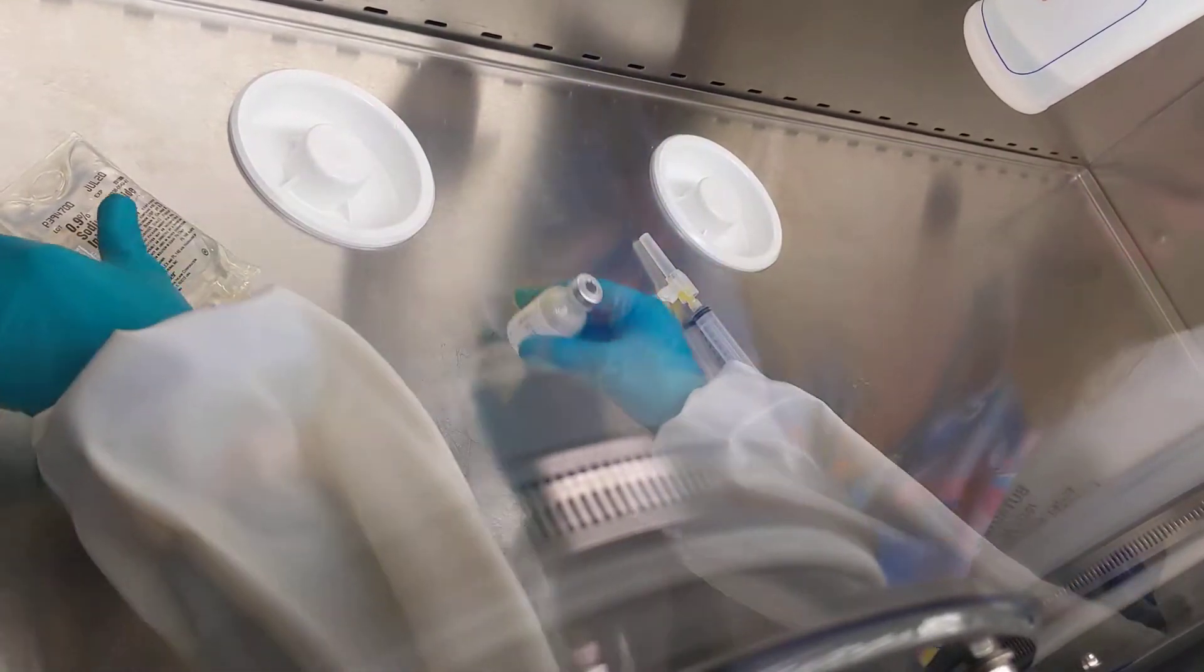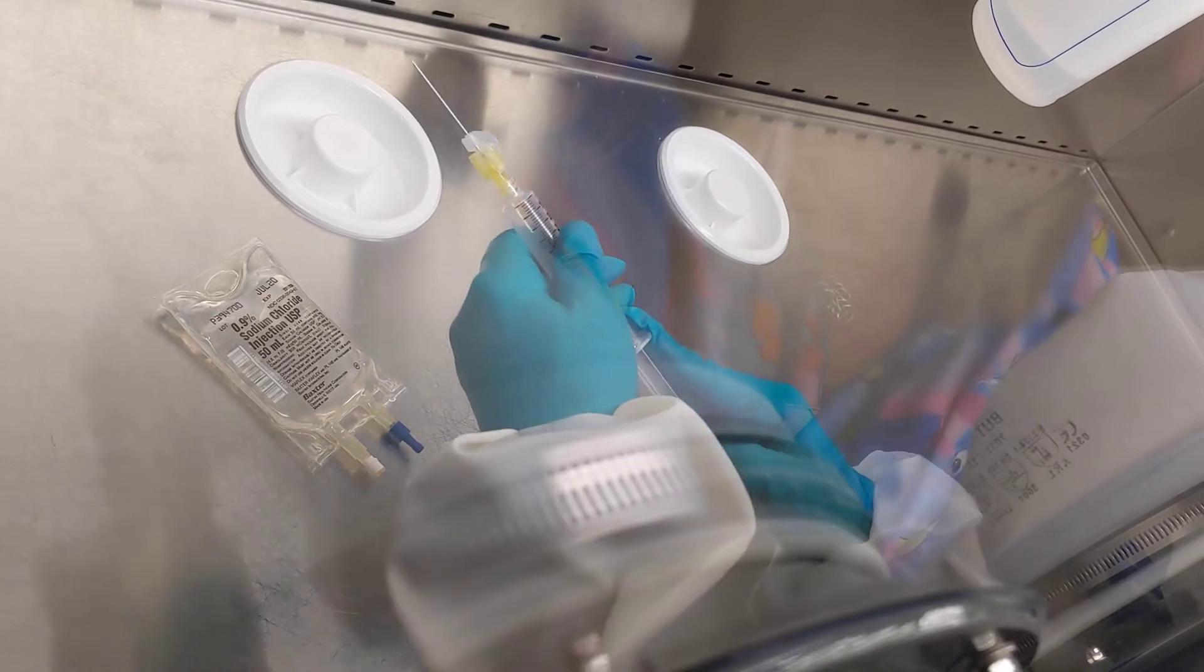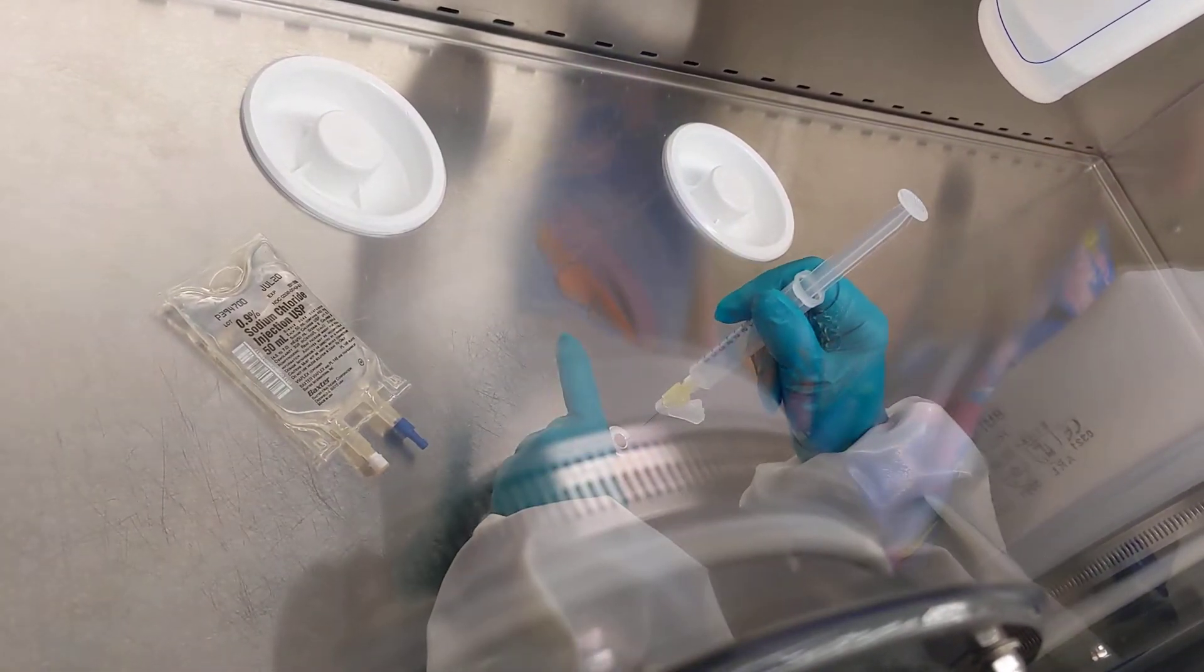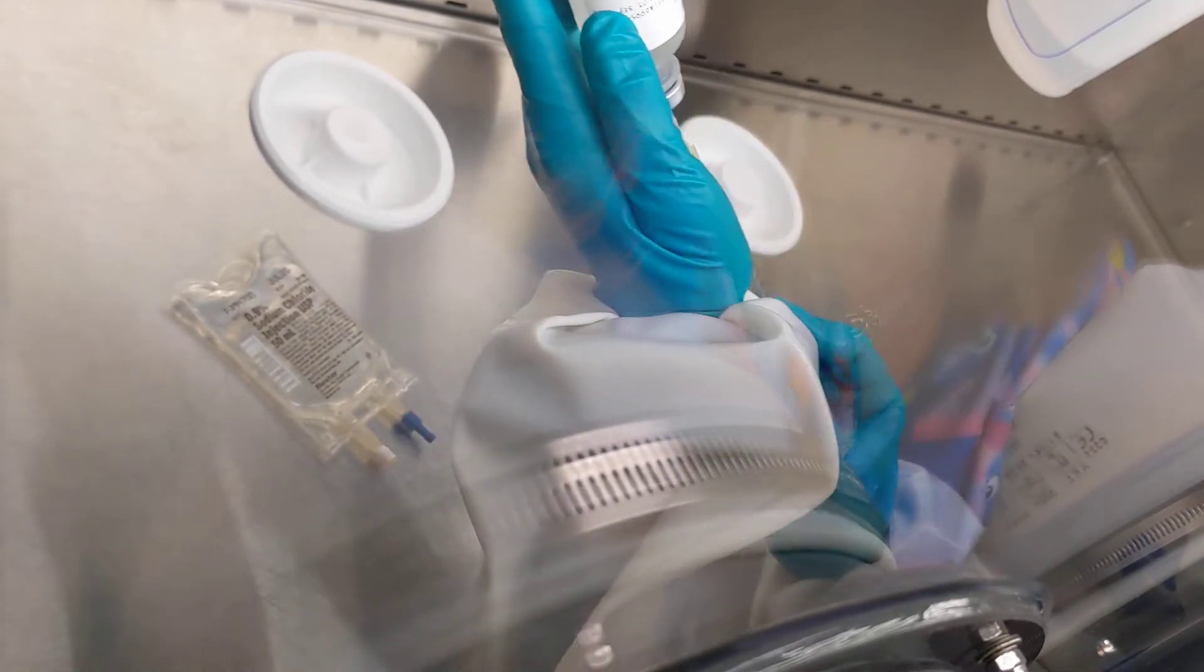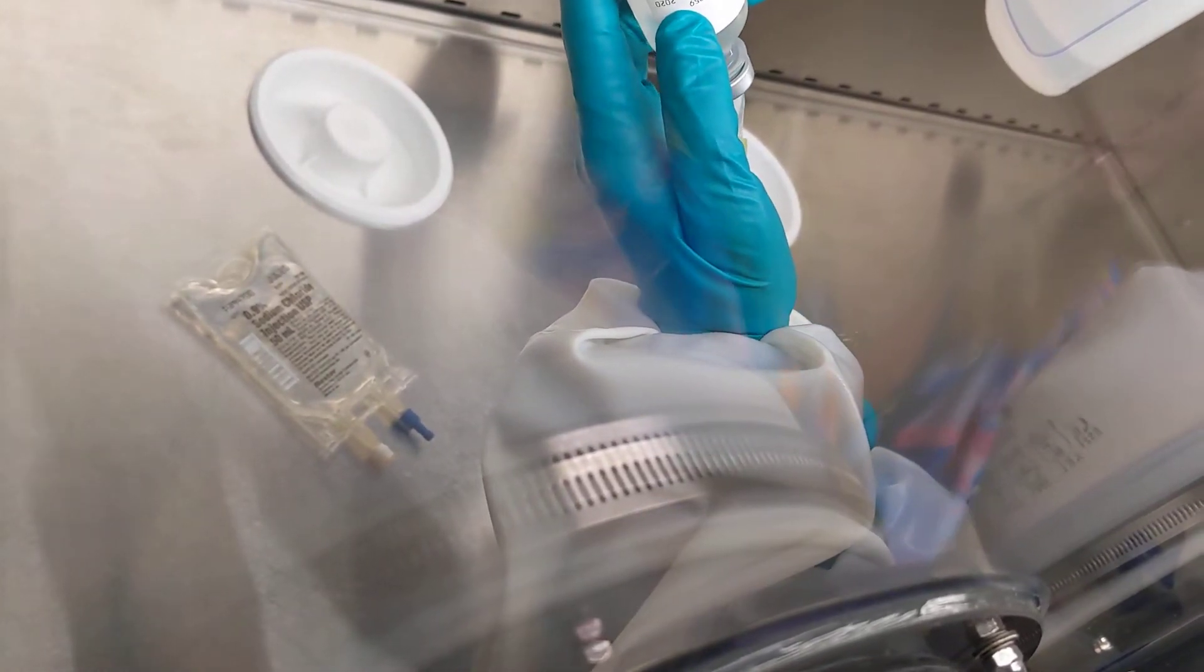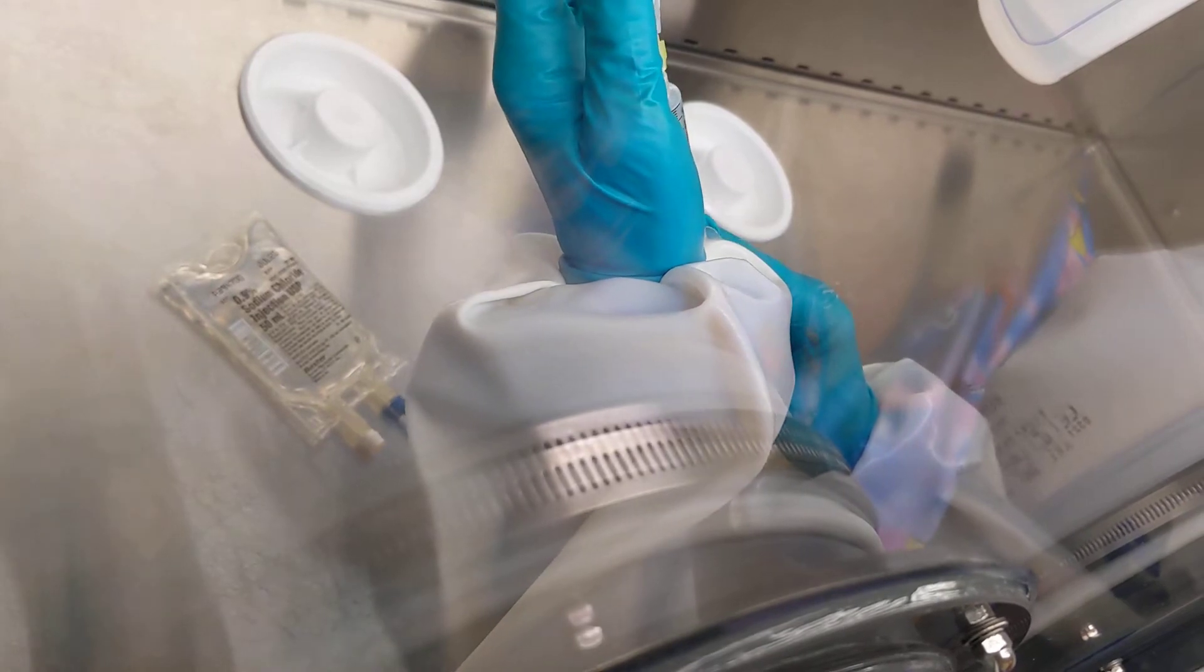This particular mix is just a simple transfer of 10 mils of this medication into this bag. The airflow is actually coming from above us, so I don't hold my hands like this—I hold it like this so that this critical area can get flushed with filtered air.